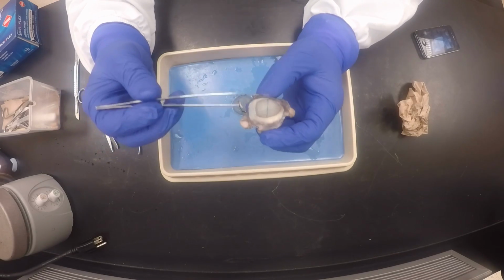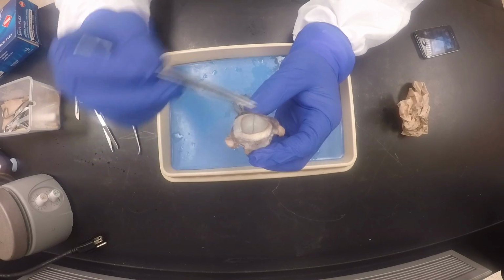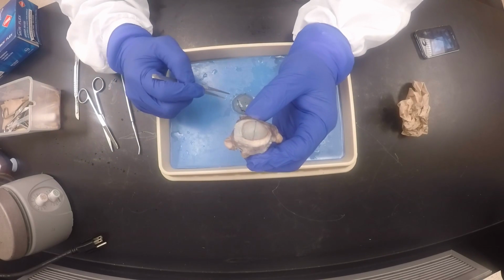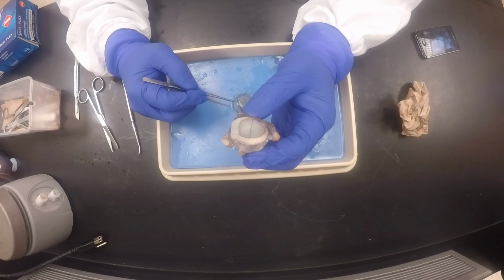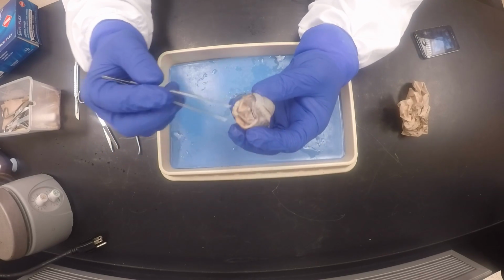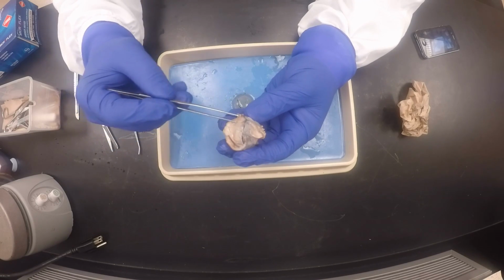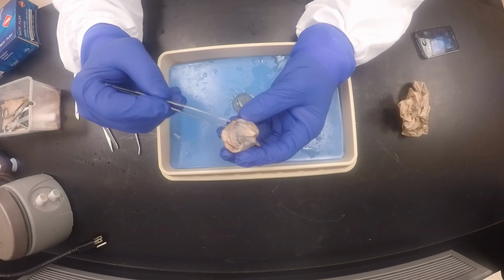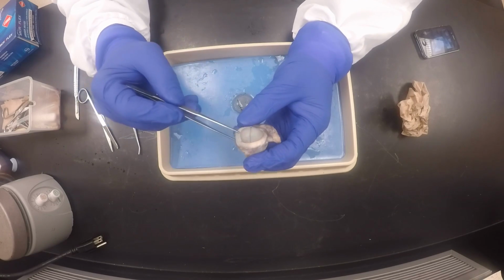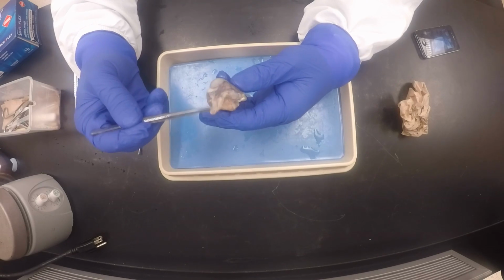I said the first order of business when identifying the extrinsic eye muscles is to look at the short sides. This is one short side and that's the other short side. You look to see if you have 2 muscles on the side, and one of the muscles will be going at an angle. I'm going to start on this side. I got one muscle, but I do not observe any other muscles there. So I go to the other side, and there, voila! I see this muscle going at an angle.